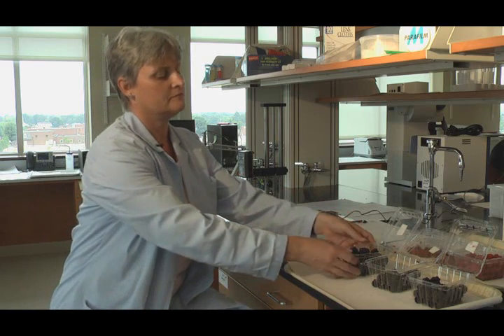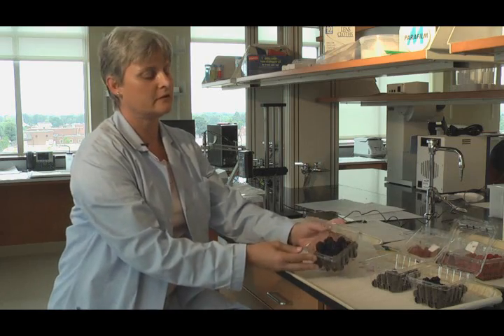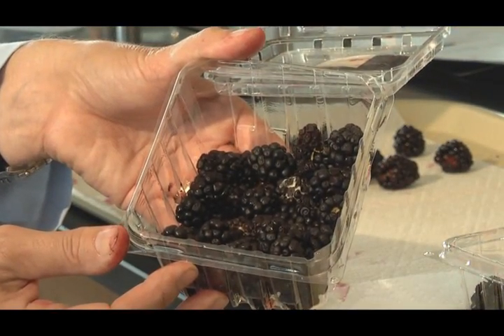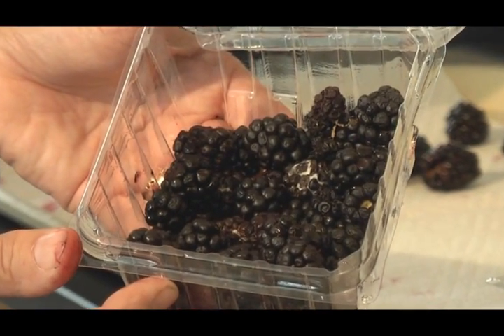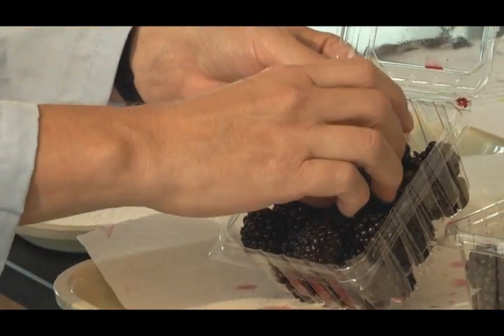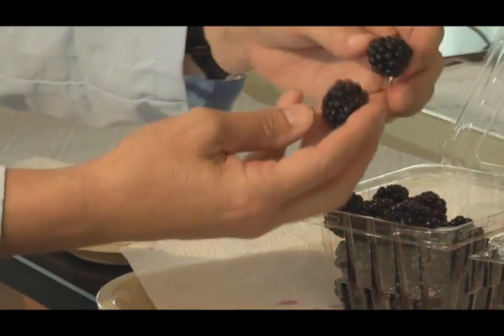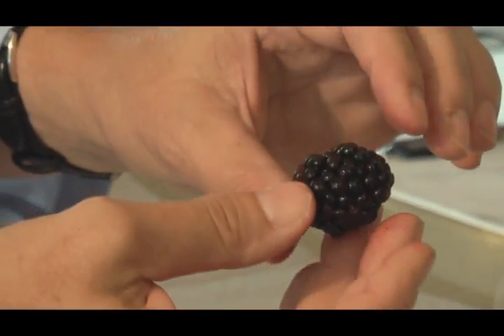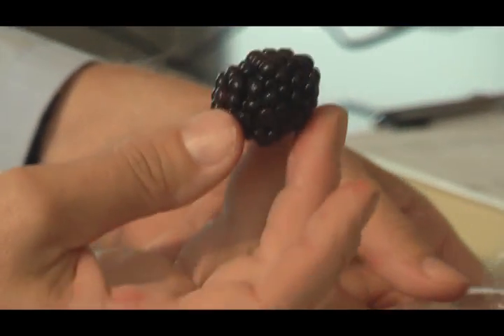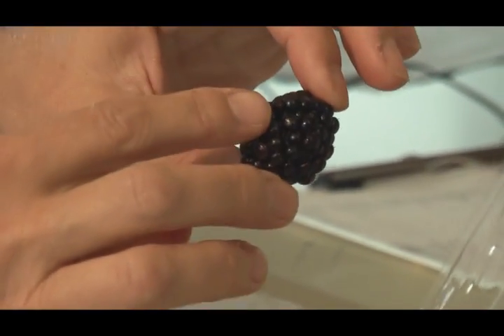The first thing we do is get the fruit out of the cooler. These are stored in clamshells and they're held at 5°C usually, or about 41 degrees Fahrenheit. I can pull these out and I already see that I have some problems with them. You see these red areas on here — that usually means that there's some sort of leakage. It was raining this morning and so we developed this reddening color, so this may be from leakage or it may be from rainfall.